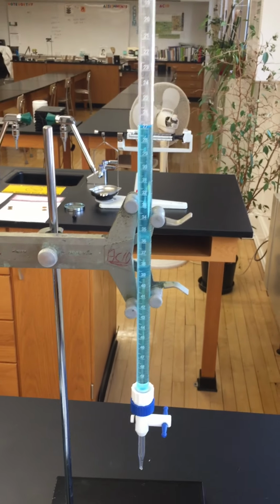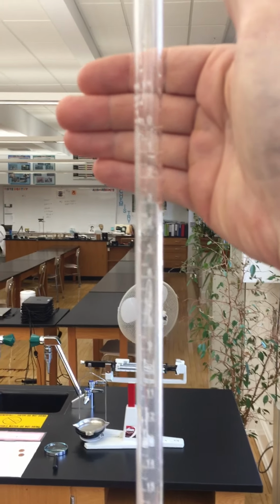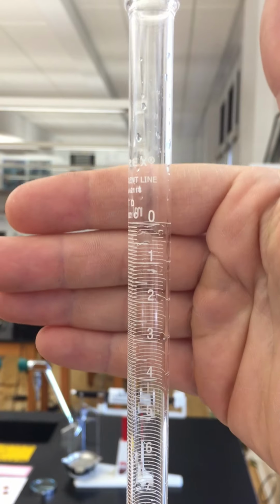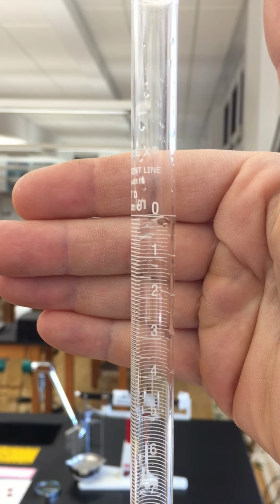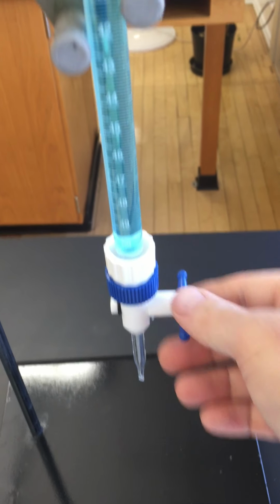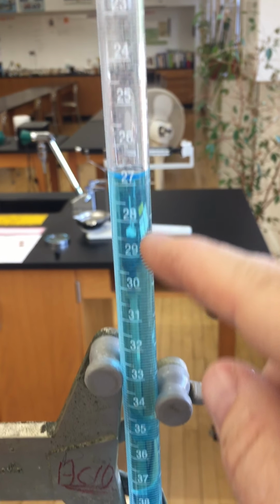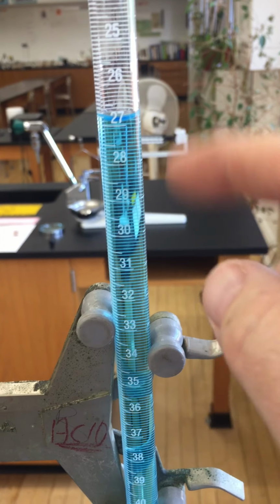Burettes and pipettes are designed to measure the volume of liquid they deliver. So here is a burette. I don't have any pipettes. As you can see at the top here, the 0 line is right there between my fingers, and then it goes all the way down to 50. When I open this up, it's right now about 27, and then it will go down. So from 27 to 29, that would deliver 2 milliliters. You don't always have to start at 0, but it makes it a little bit easier.